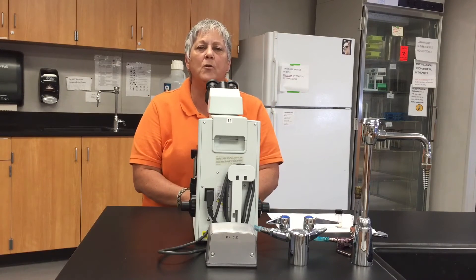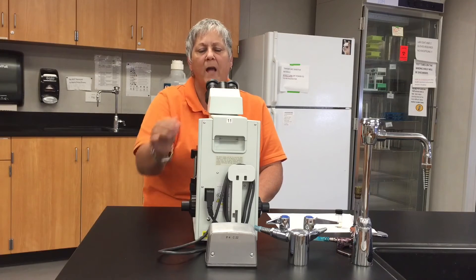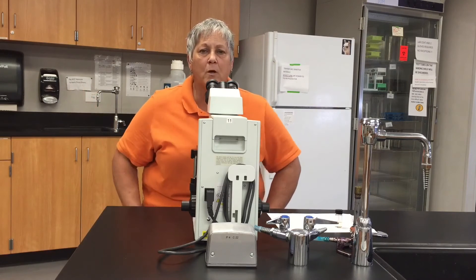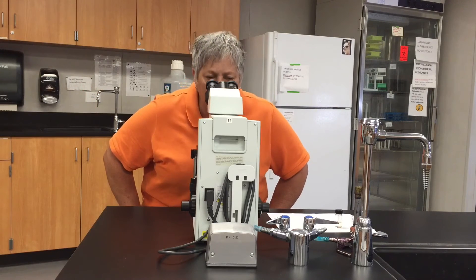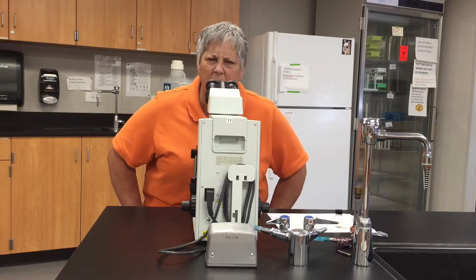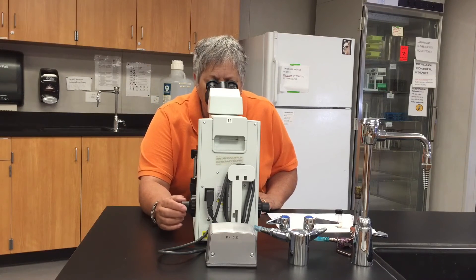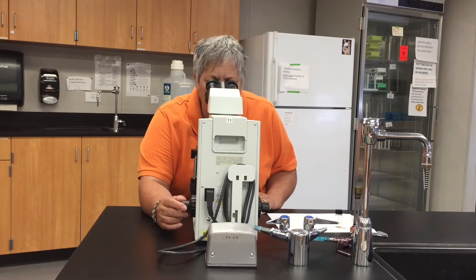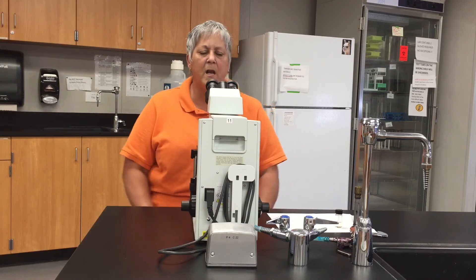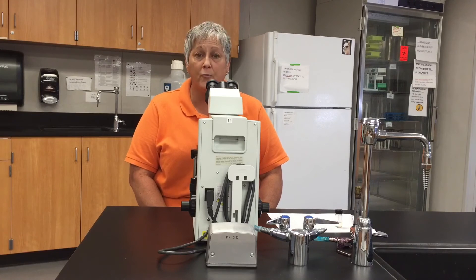To review: low power, stage at its highest position, place the slide, get the specimen under the objective lens, slowly turn the coarse focus towards myself to lower the stage until I find it, then fine-tune with the fine focus. Now I'm in focus under low power, so I'm going to switch to the high dry lens. There it is but it's kind of fuzzy, so I'll play with the fine focus up and down just a little bit until I've got it into nice sharp focus under high dry.